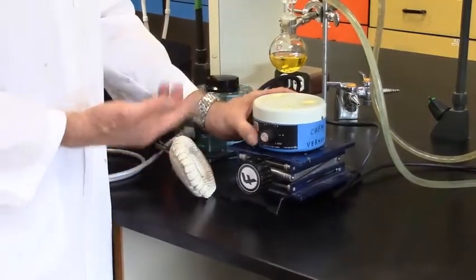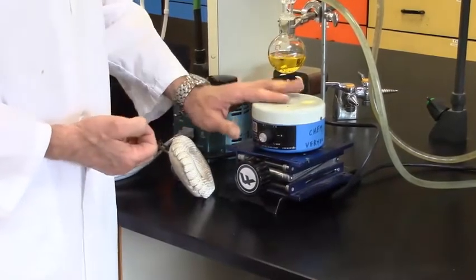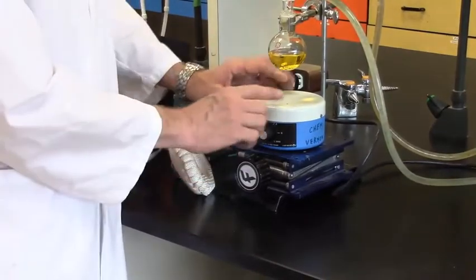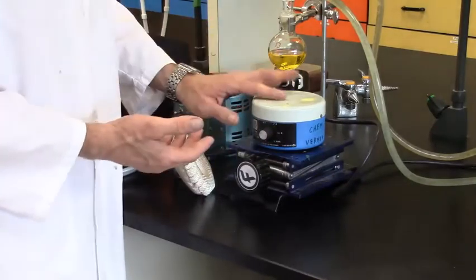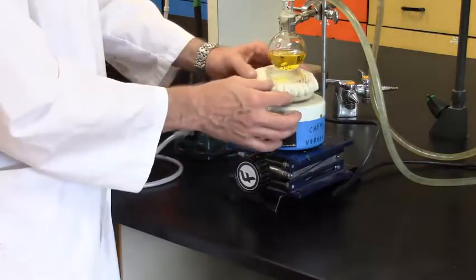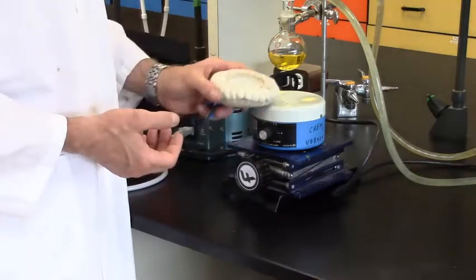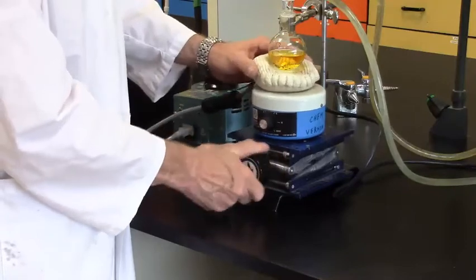In the Kelowna lab, and I believe several other stirrers in the Vernon lab, the stirrer top is actually plastic. We do have clay porcelain tiles which we like to put on top of the plastic stirrers just to mitigate melting of the stirrer top. The heating mantle is specific to its size — this one is marked 100 on the bottom, indicating it is appropriate for a 100 ml round bottom flask. We have them in other sizes for different reaction vessels.